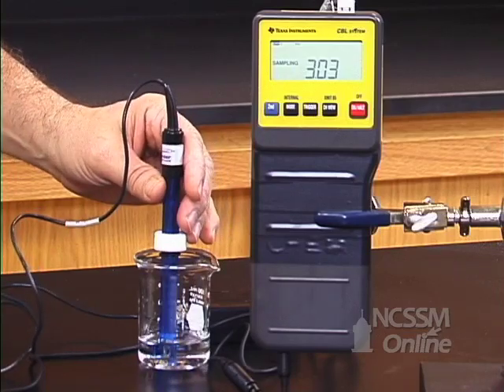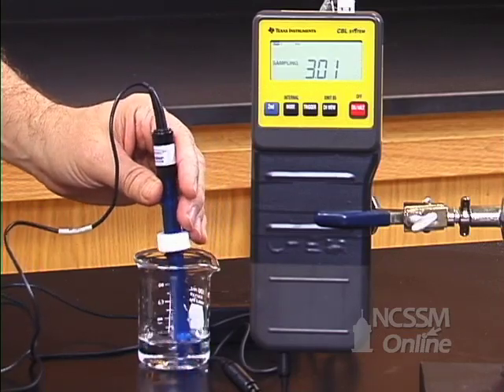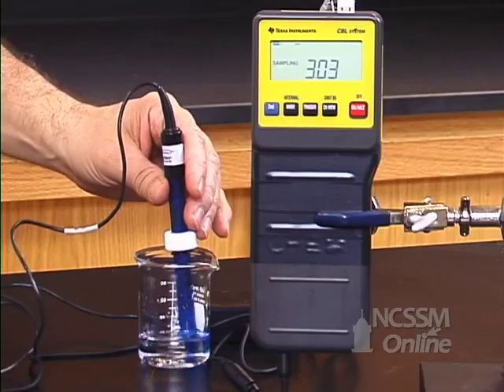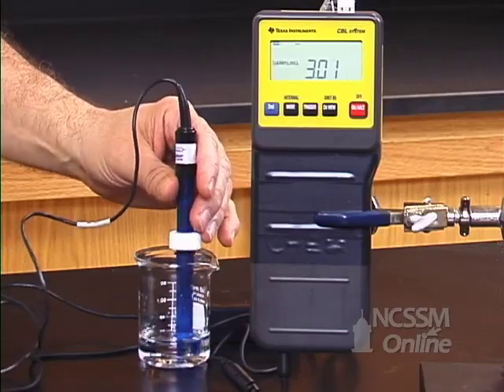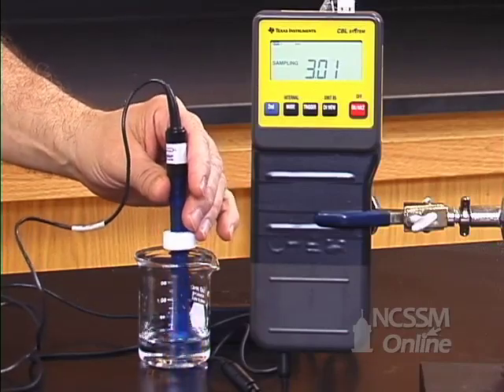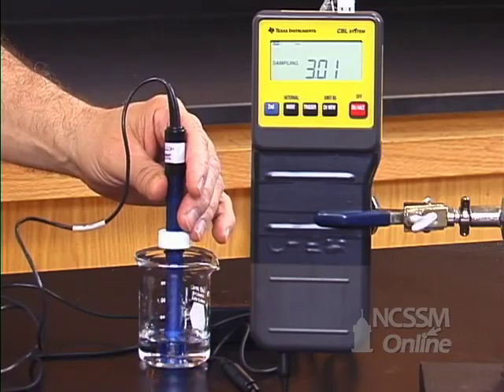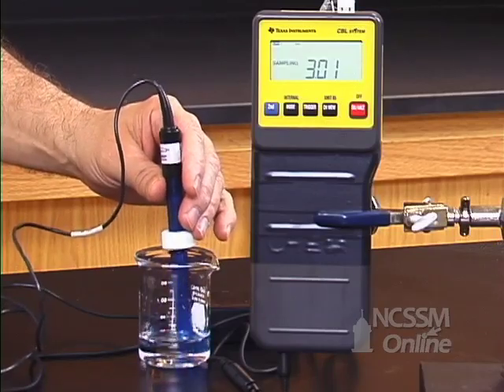If we add a strong acid to it, the strong acid ionizes 100%. If there's no buffering capacity in the water, the pH drops rapidly.